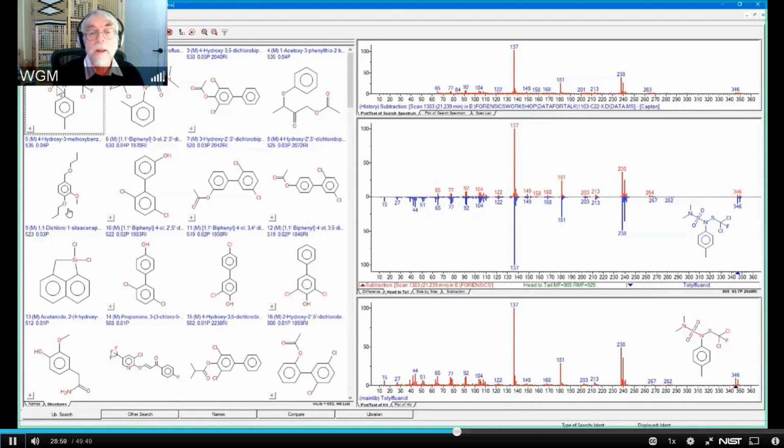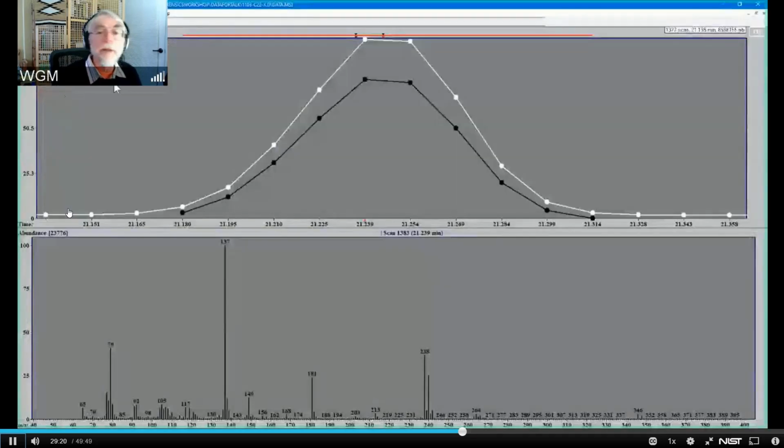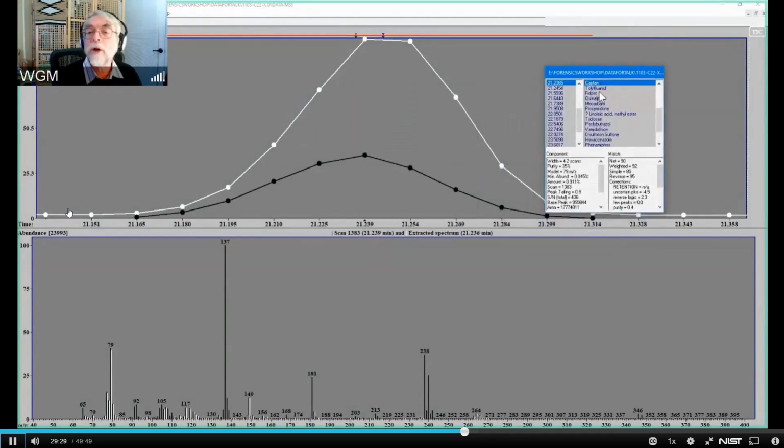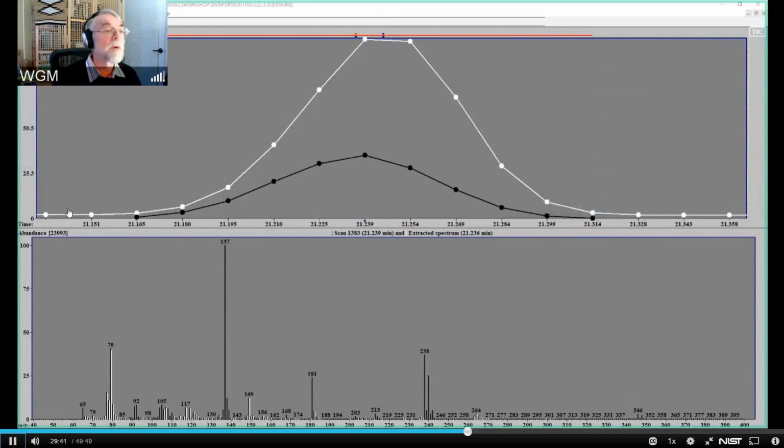So we've got here a tool that we can add to AMDIS for those really difficult problems. And the problem that we attacked here was not one that AMDIS hadn't been able to solve. It was one that AMDIS had solved. I'll go back to AMDIS, and if I look at these two things, I'll bring the answers over here. You see that it's actually already identified these things, but that's because they were in the library. If they hadn't been in the library, there would just be little triangles here, and I would have been able to search them with the NIST program.